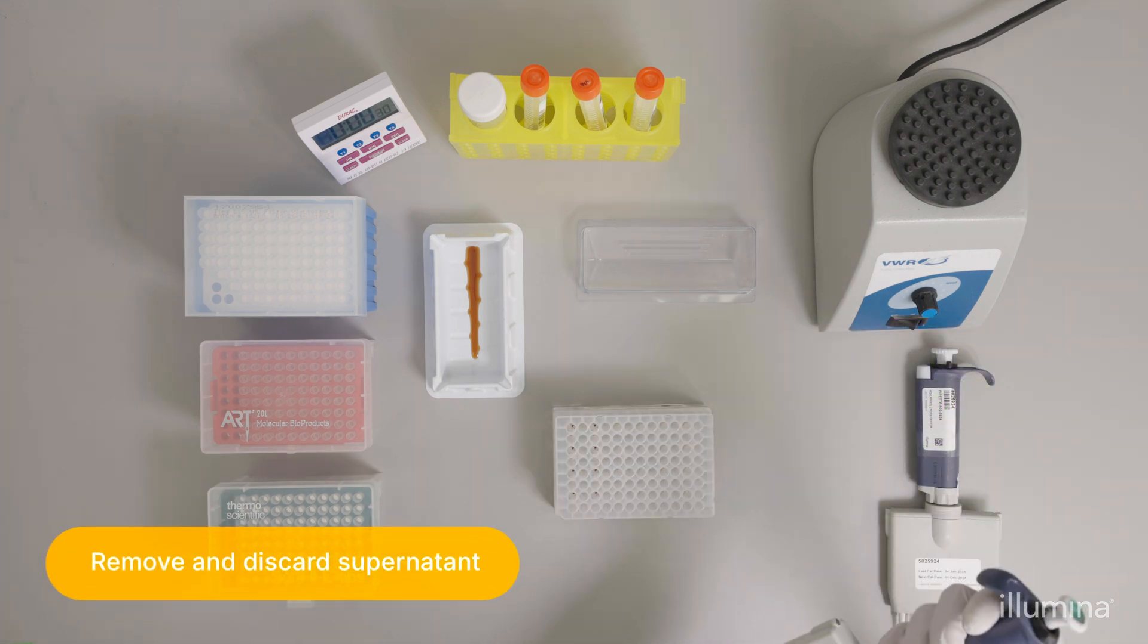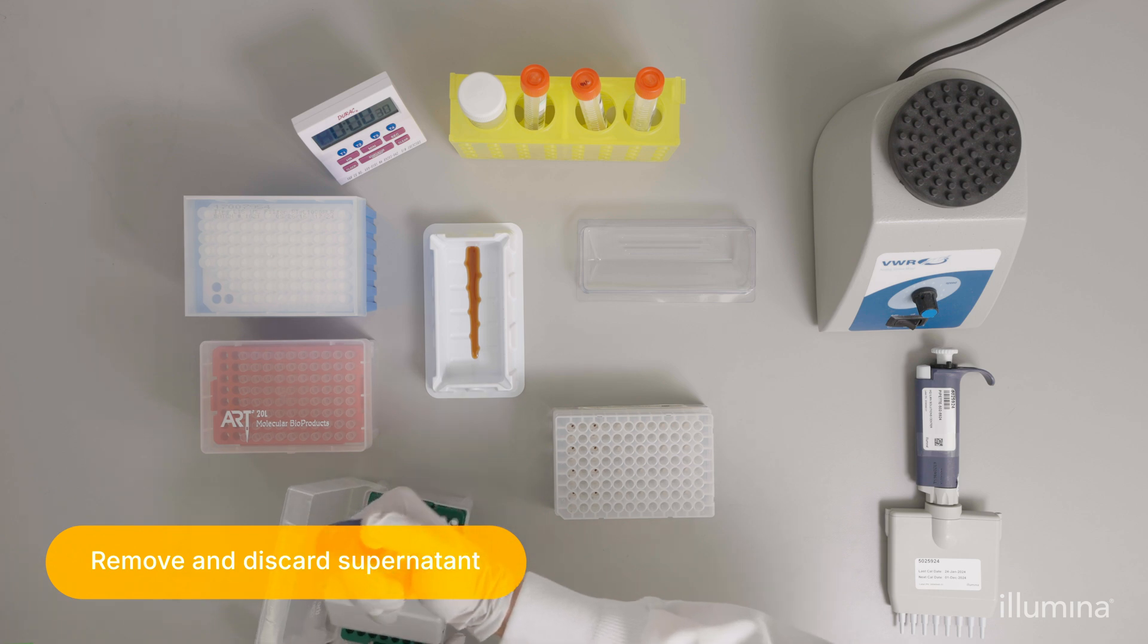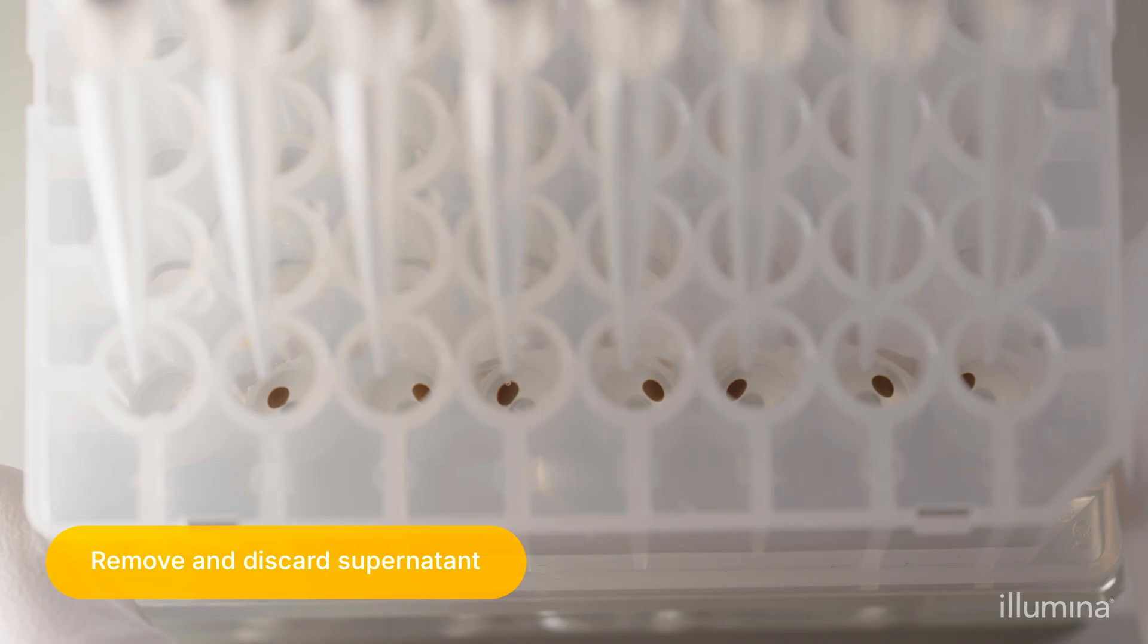When incubation is complete, keep the plate on the magnetic stand and without disturbing the bead pellets, use a 200 microliter multi-channel pipette to remove the supernatant from the well.